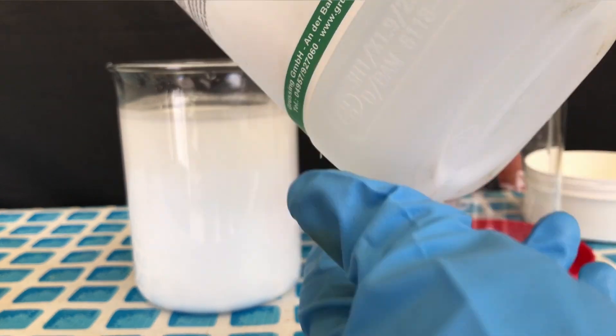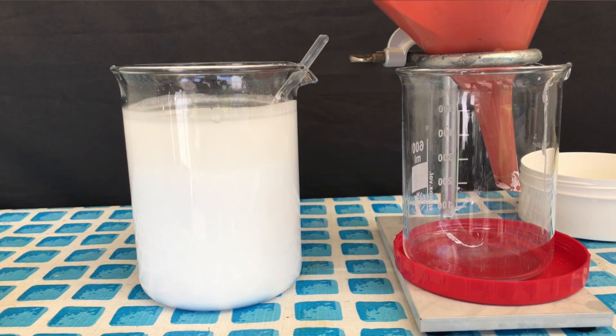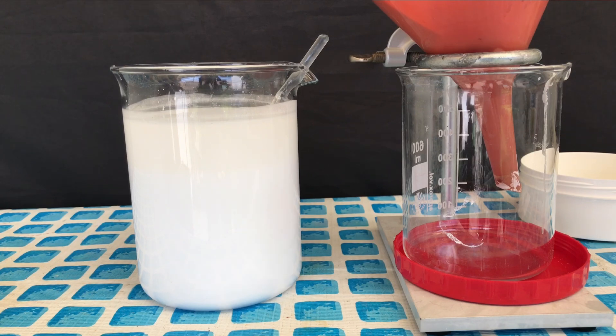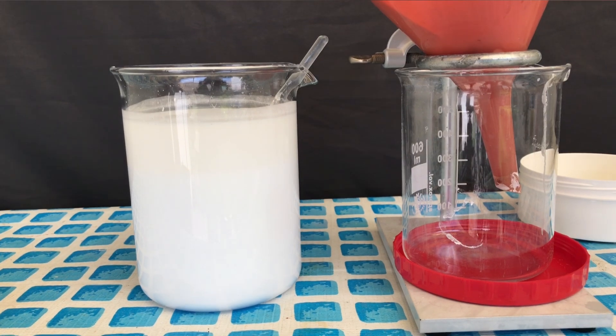In the upper layer there's water and maybe some more lead acetate, and to make sure there's no more lead acetate left we added more hydrochloric acid. Nothing crashed out and therefore all lead acetate has already reacted.